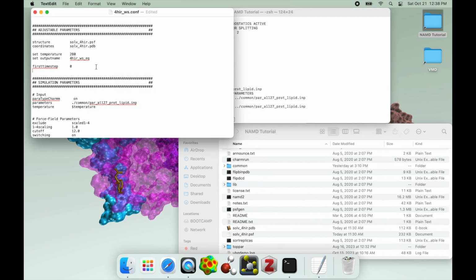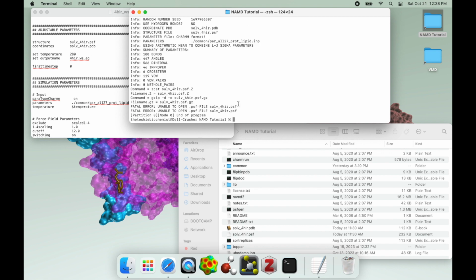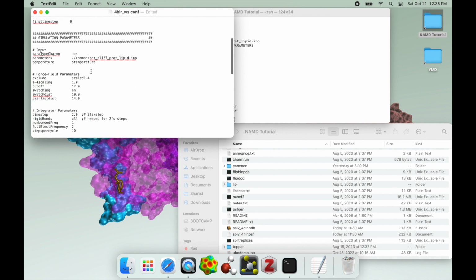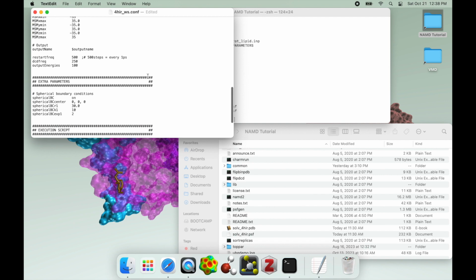Next, I'm going to correct that so it looks in the right place. But I'm going to change and misspell the PSF file, solve instead of solv. So if I run this again, now it's going to say unable to open the file. And that's because, again, as far as the computer is concerned, it doesn't exist. Why does it say unable to open instead of unable to locate? Impossible to say, but that's what's going on there. So if I change that back, now it'll run cleanly.